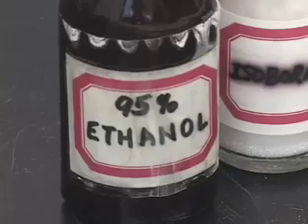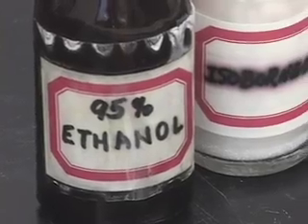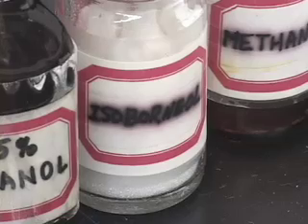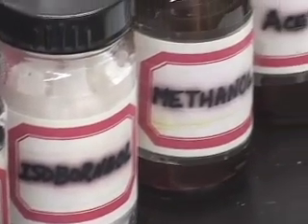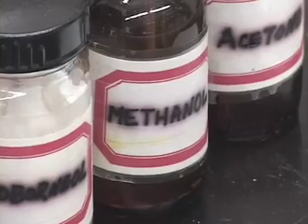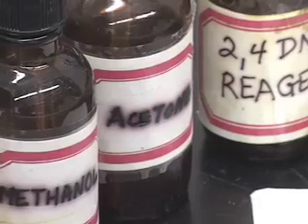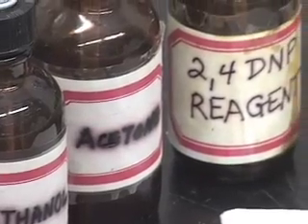If the compound is neither a ketone nor an aldehyde, we will not observe a yellow to orange or red colored precipitate. Let us see what happens when we test some compounds with the 2,4-DNP reagent.